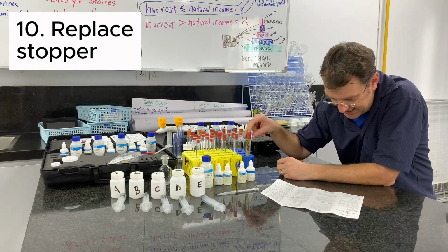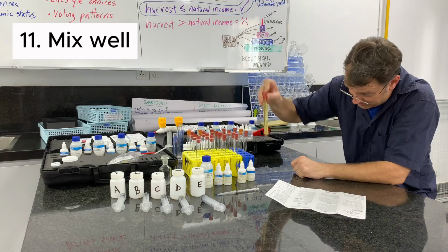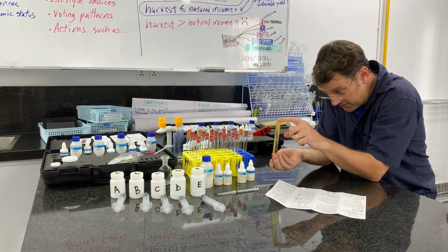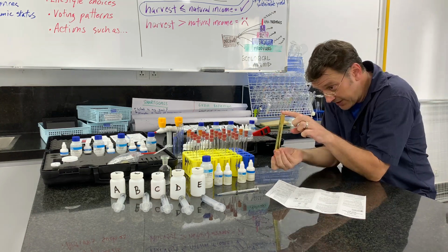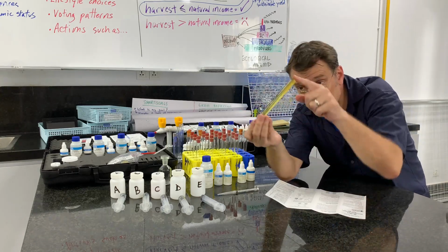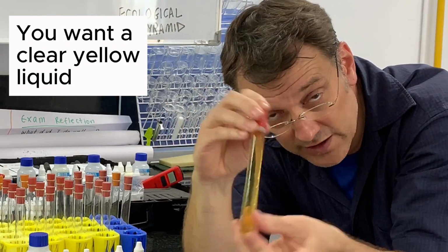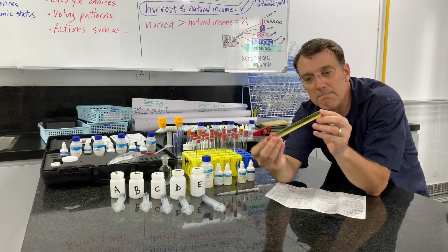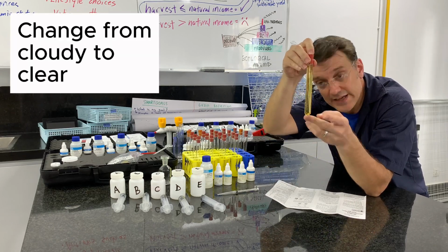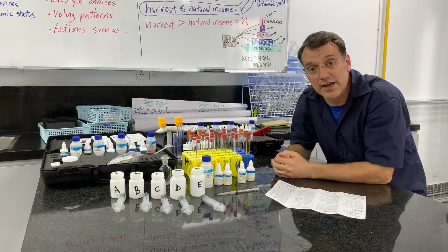I'm going to stopper it again, and then what I'm looking for this time, I'm going to take my sample and start to shake it and mix it. It becomes less cloudy. I've still got some cloud up here, so I just need to make sure that I'm turning it back and forth to get it to really mix. And if you can see this sample clearly, it's losing the cloudiness, but it still maintains that yellow color. So it goes from being this milky, yellowish, orange, cloudy solution to a clear yellow solution that frankly looks like a urine sample. So now I've got my clear yellow sample.